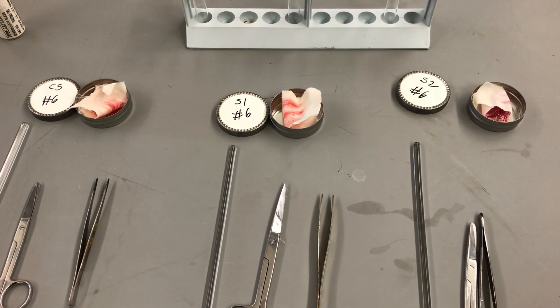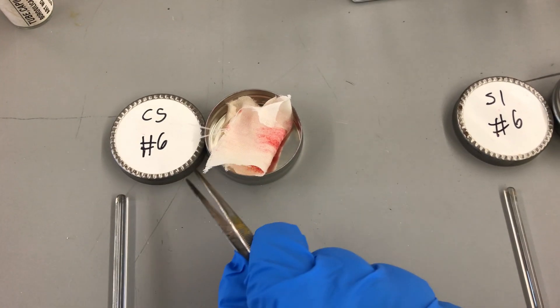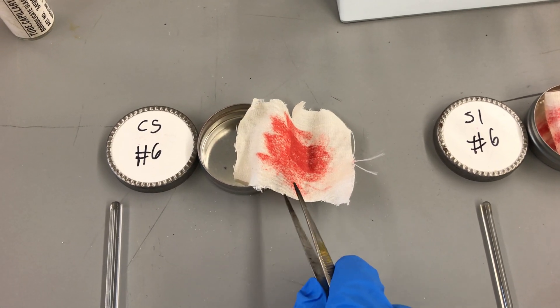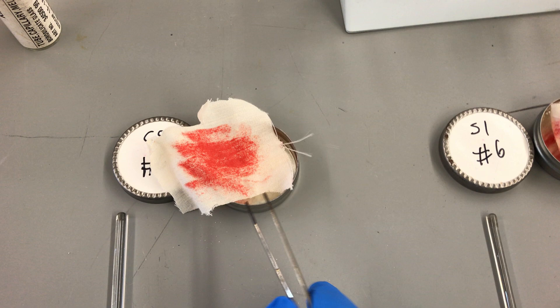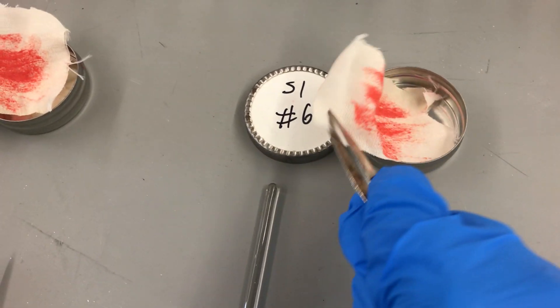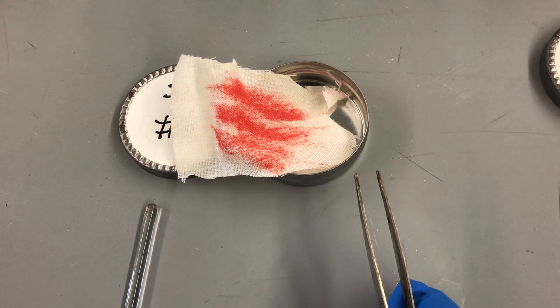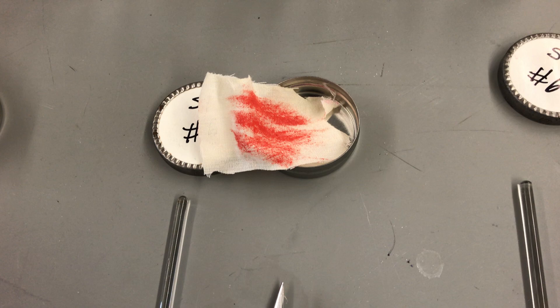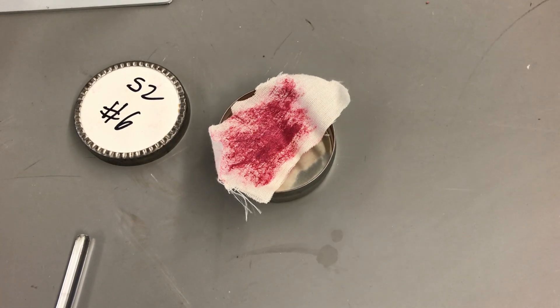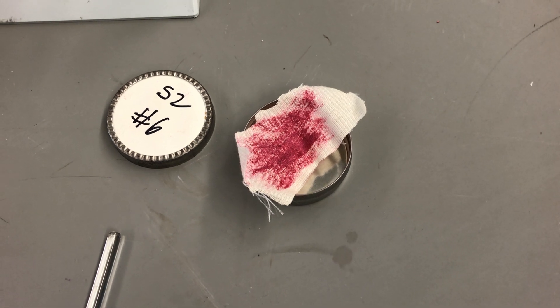The first thing we need to do is record the color of our lipstick stains. Taking the proper forceps, I'm going to open up our evidence. Our crime scene sample is a very bright red color. Our suspect one sample is also a very bright red color. And then finally, our suspect two sample is more of a maroon or almost a purple color.